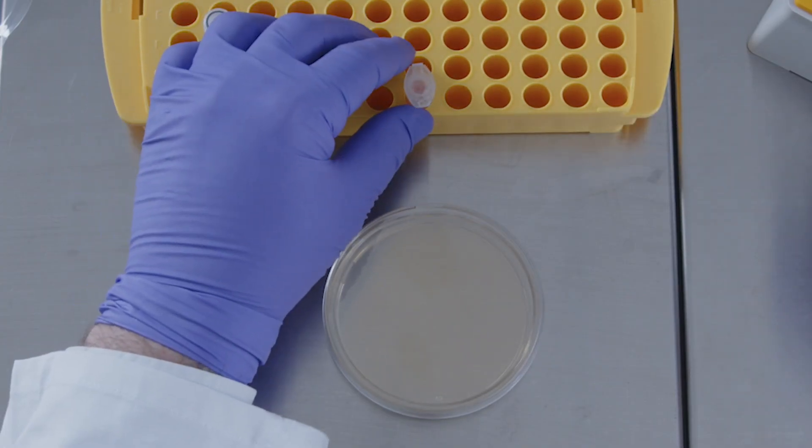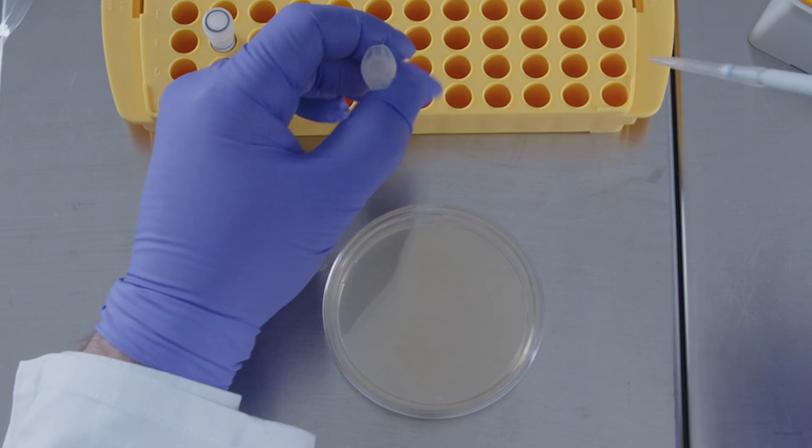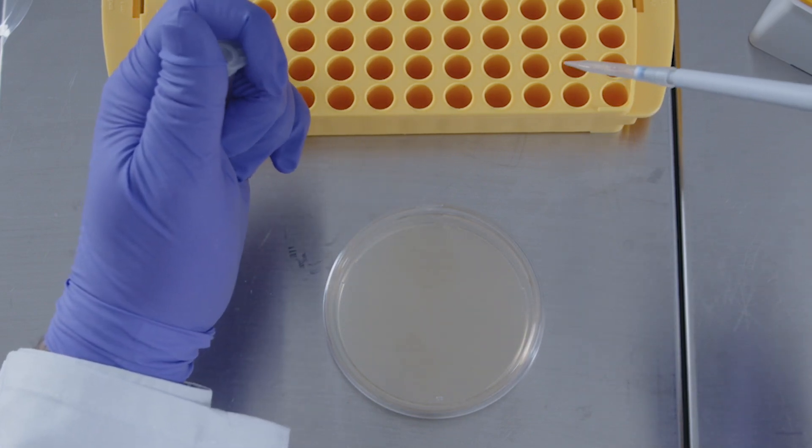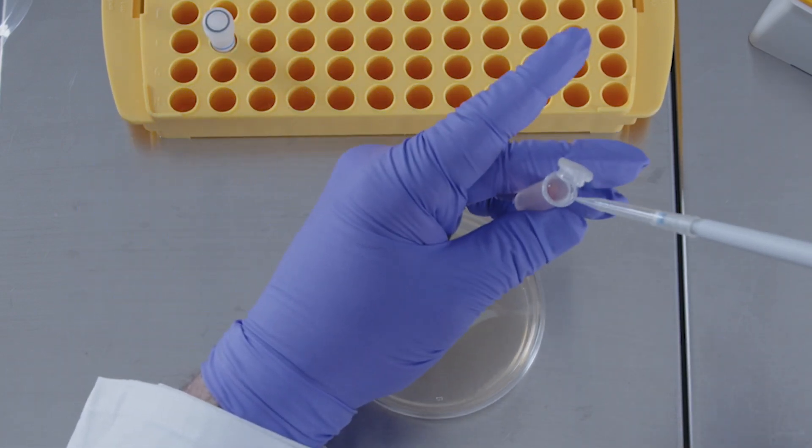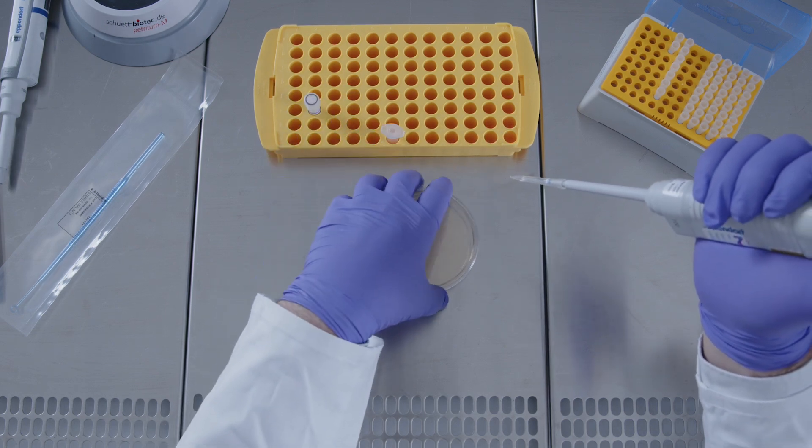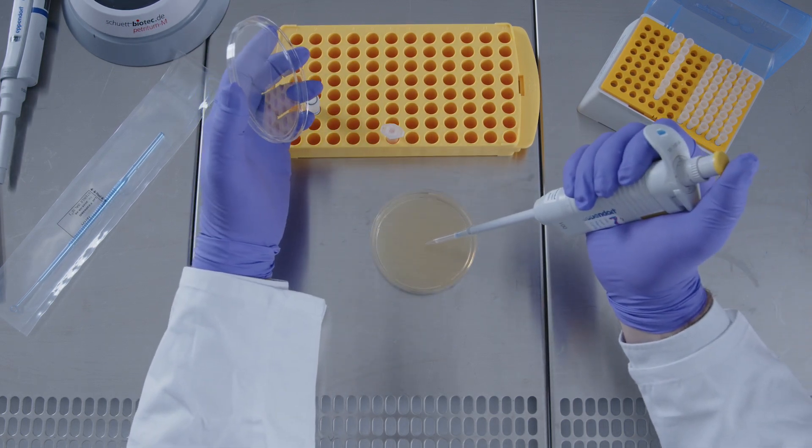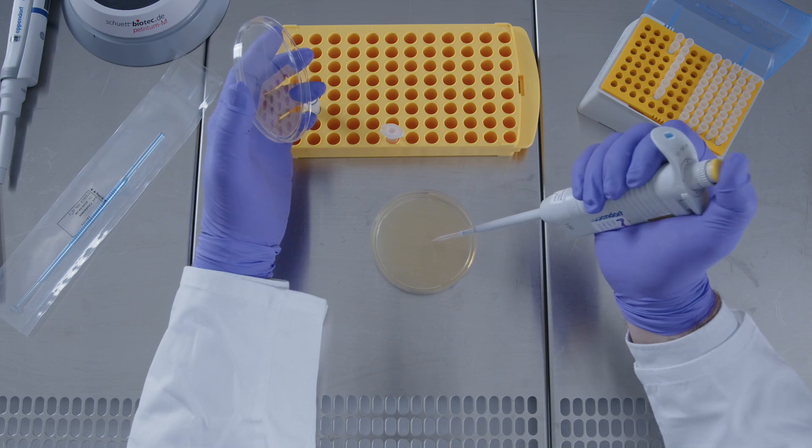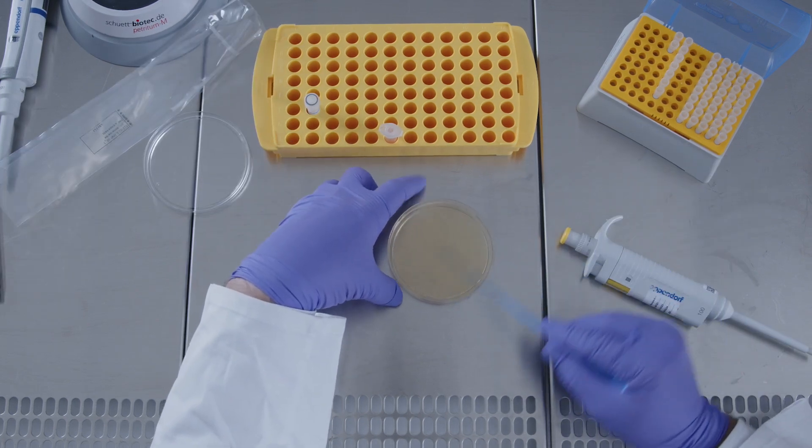Leave the inoculated liquid at room temperature for 10 to 15 minutes. Apply the right amount of inoculum onto an agar plate for the desired CFUs. Spread the liquid over the entire plate.